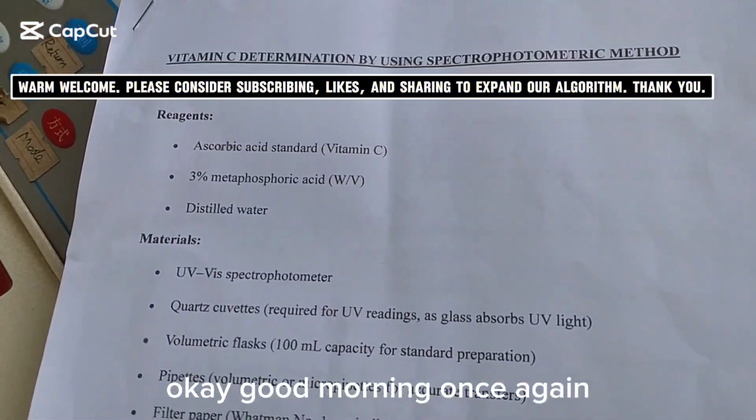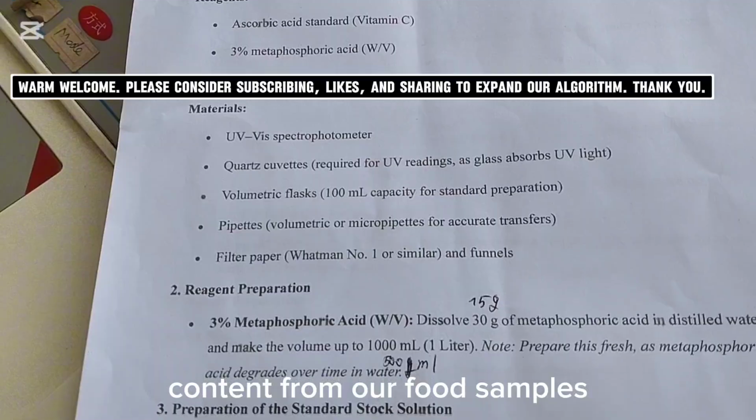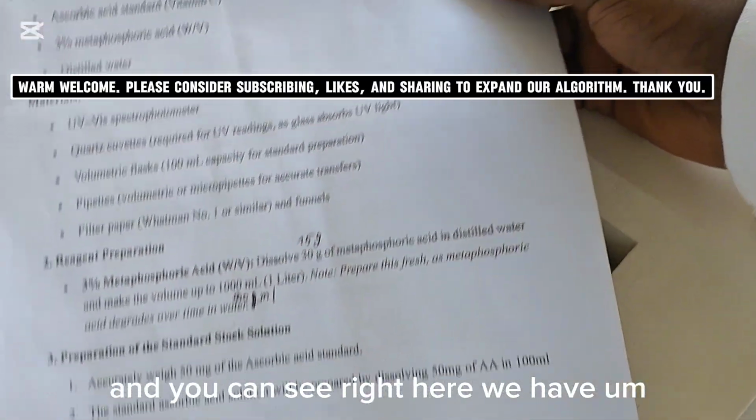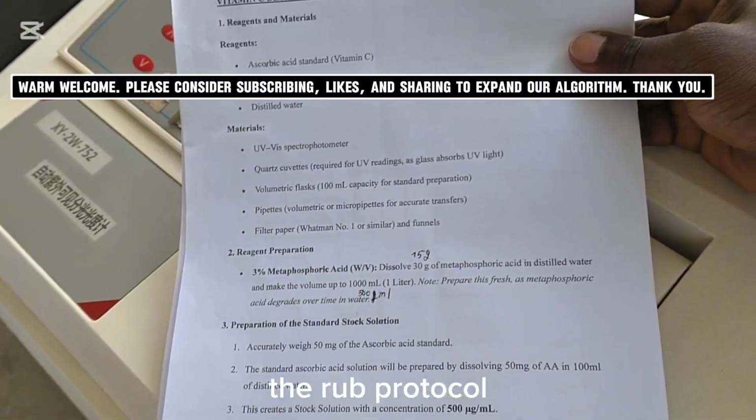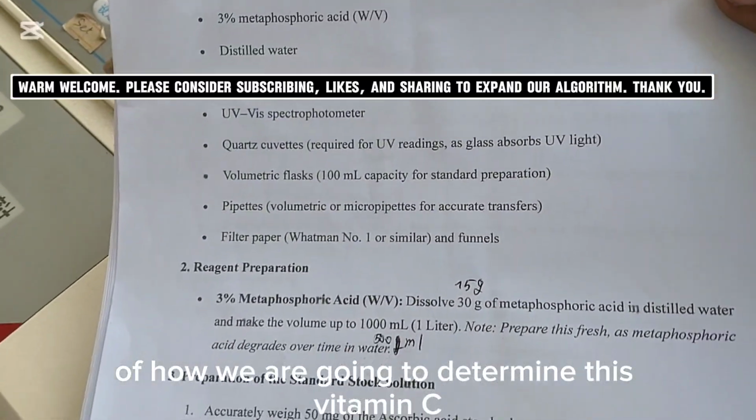Okay, good morning once again. We are going to determine vitamin C content from our food samples. You can see right here we have the lab protocol of how we are going to determine this vitamin C.